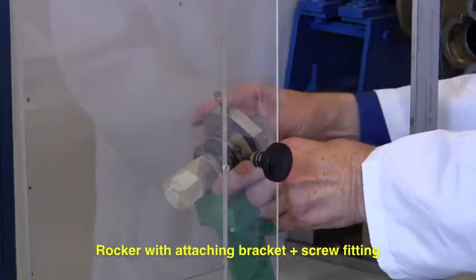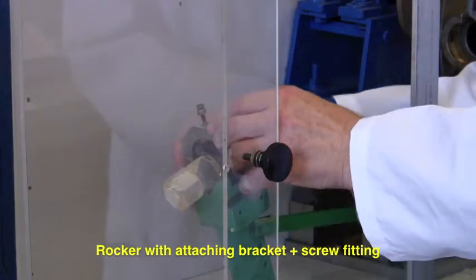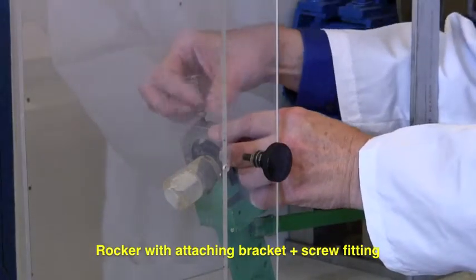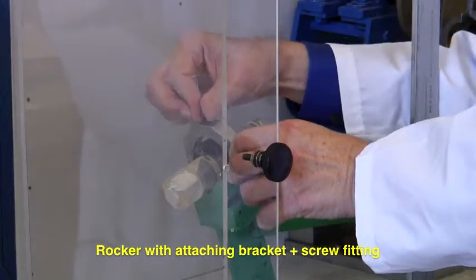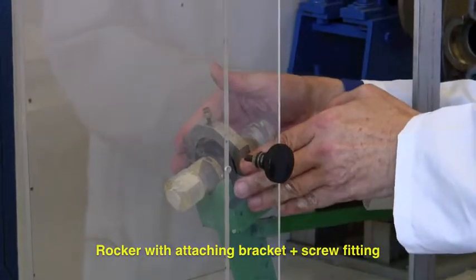It slides over the top, place it over the center, and then tighten the screw to hold everything tight in place.